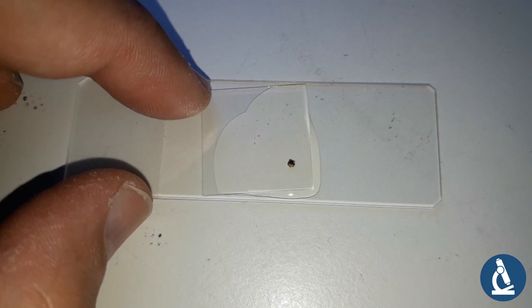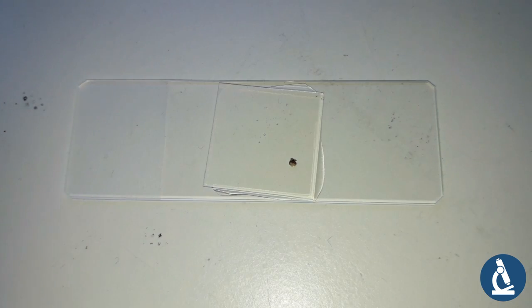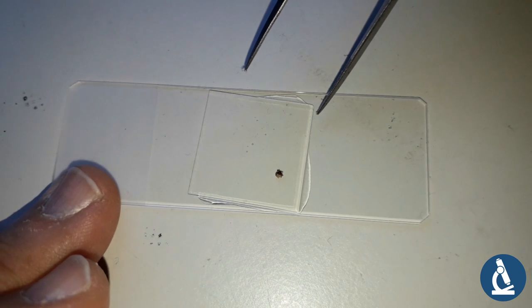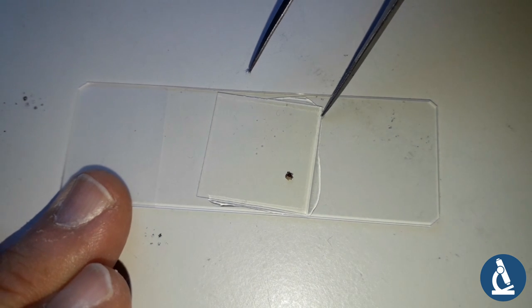Unfortunately, I did make a little mistake here because the tick is now not in the center anymore, but I think that's okay. The mounting medium will still preserve it quite well.